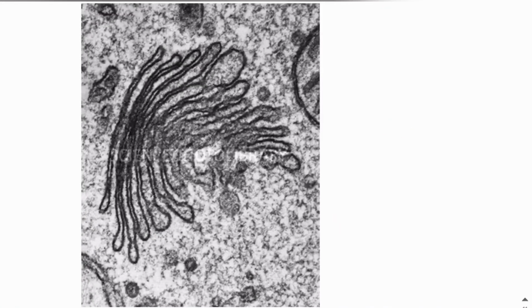What is this, guys? This is Golgi apparatus. You can see curved sacs. This is a very good picture. Normally we are not able to see such a picture of the Golgi apparatus. And these are Golgi vesicles. So this is a highly magnified image, a very clear image showing the Golgi bodies, which are curved sacs, right? This is the image of centrioles, which are cylindrical structures at right angles or at 90 degrees to each other, right? These are centrioles.